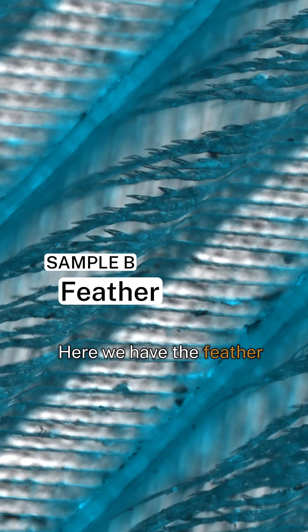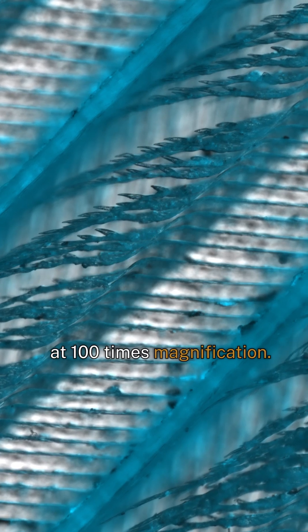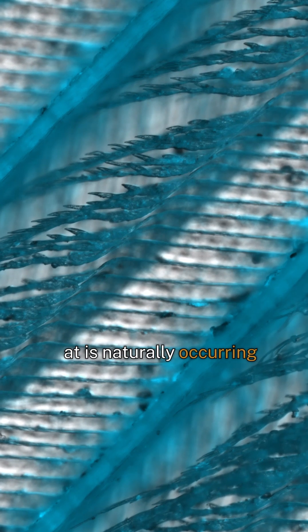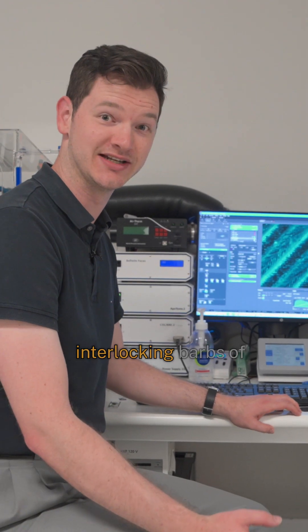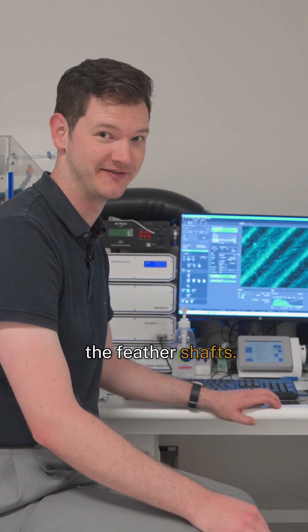Here we have the feather at 100 times magnification, and what we're looking at is naturally occurring autofluorescence. You can see the individual interlocking barbs of the feather shafts.